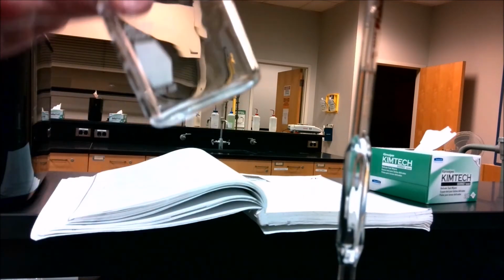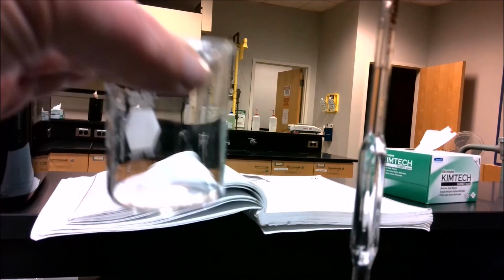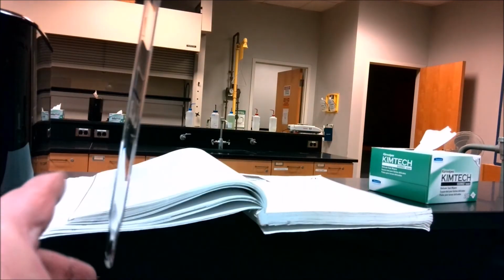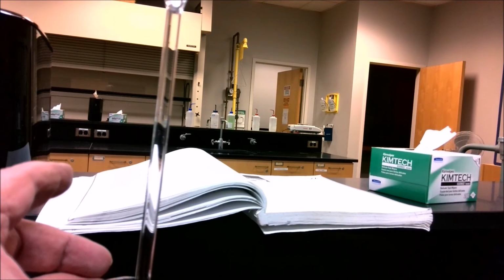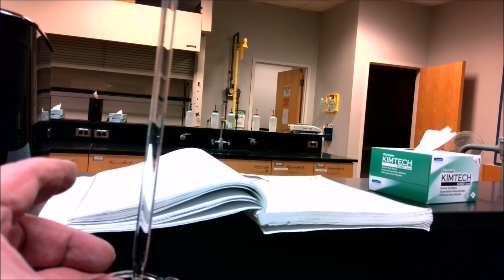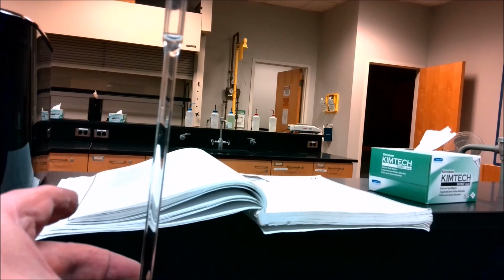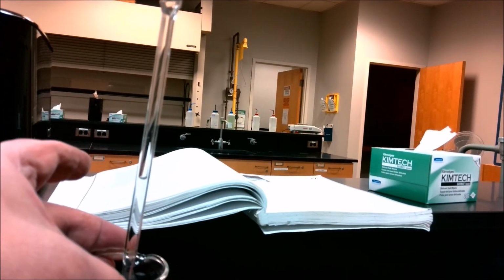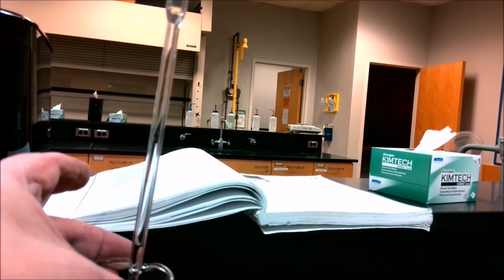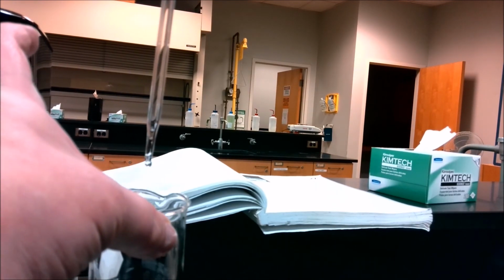In the actual process, we'll weigh this beaker before we put the liquid in, but then I just let the liquid go. I remove my finger from the top of it, and the liquid starts to drain. I let gravity do all the work. I do not put the pump back on and try to force the liquid out. I definitely don't use it like a straw or a blowgun. And the liquid drips down.